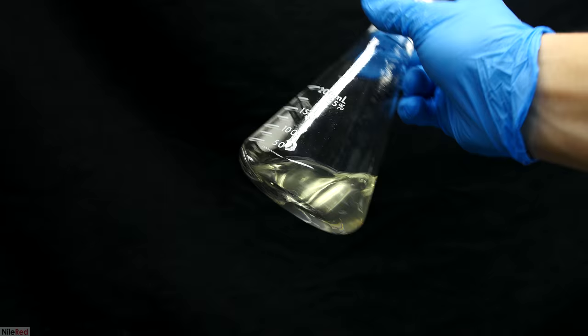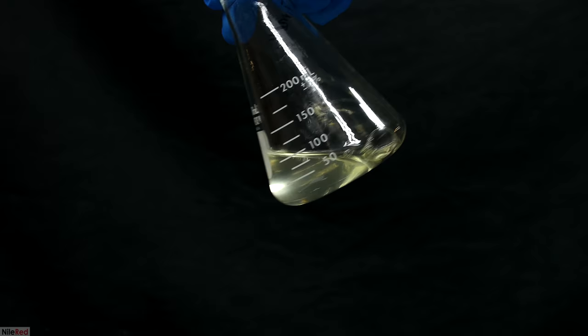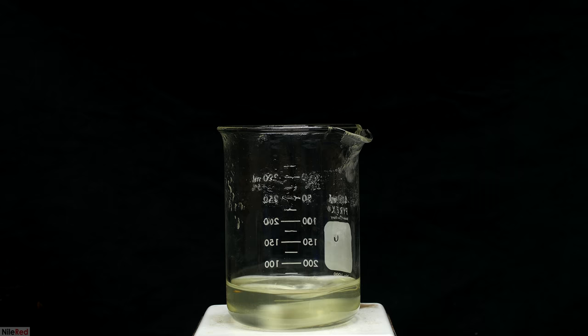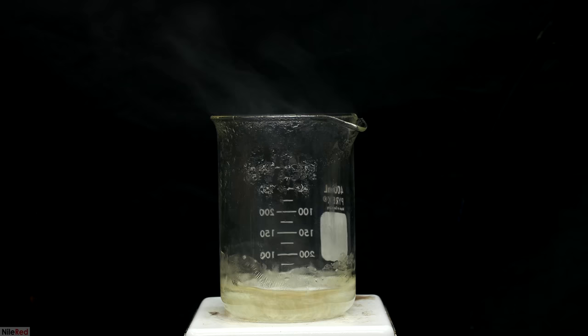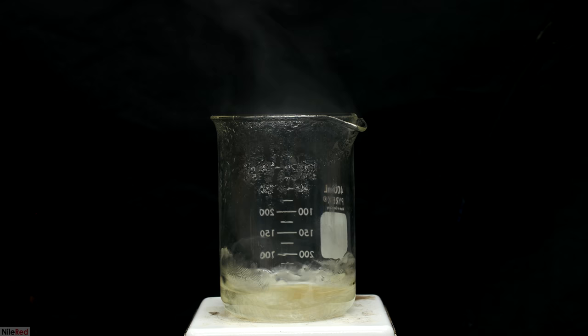Here's the liquid that passed through the filter, and there's actually still trimethylamine in it. To get it out, I did the exact same thing as before. I just heated it until crystals started to form. Once the solids started to collect on the side, I took the beaker off heat, let it cool down, and then filtered off the crystals.